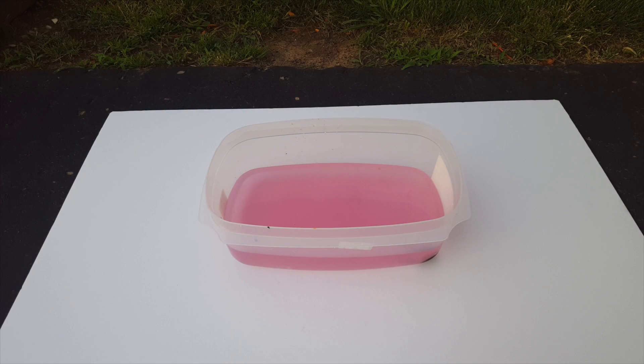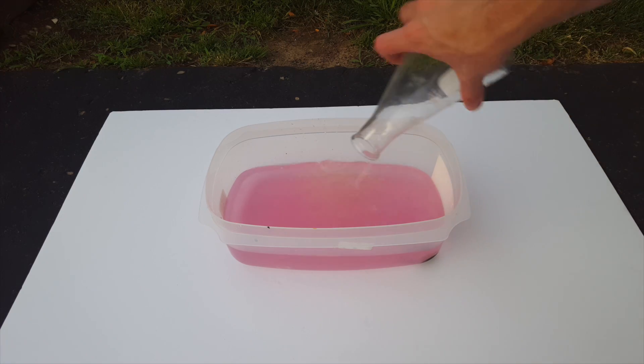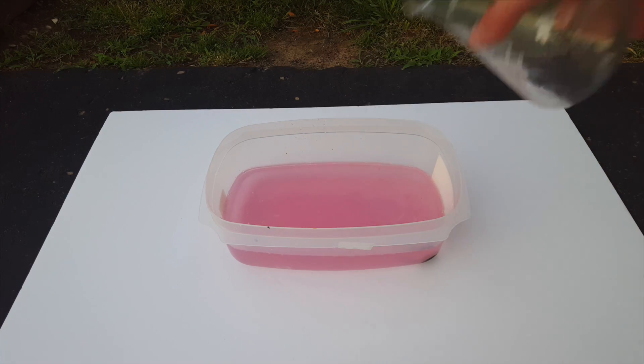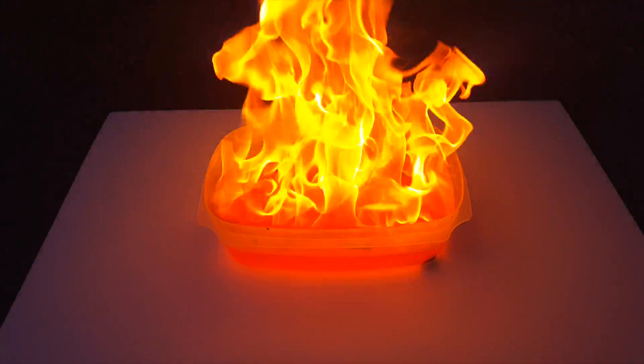So, when all was done, I had a bit of sodium and potassium which were now contaminated, so I wanted to dispose of them. Normally I would just throw them in water outside, but I decided to add gasoline that I had left over, and to light it on fire. Here's what happened with the sodium.